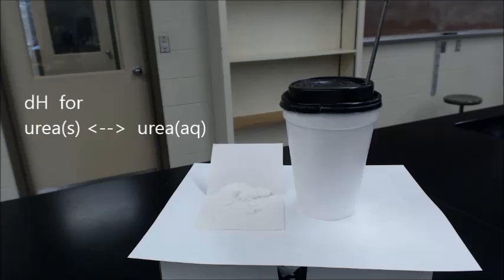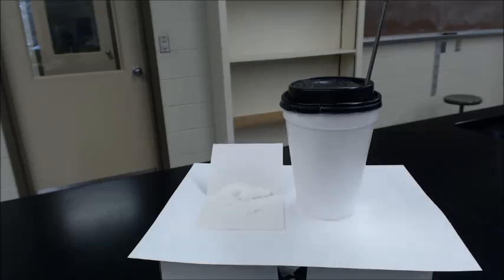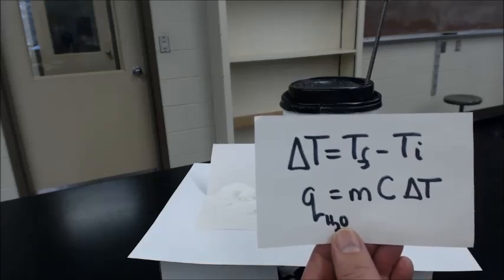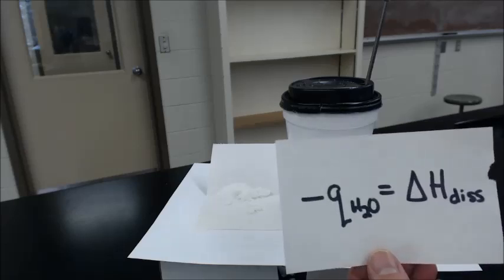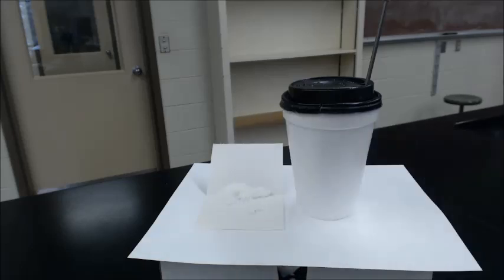Okay, we are now going to figure out the delta H dissolution for urea. It involves using a coffee cup. Our goal is to get the change in temperature. Once we know the change in temperature, we can plug that into the MCAT formula and figure out the energy that is in the chemical reaction that goes into water. Then we'll know the delta H. It's the opposite sign of water.